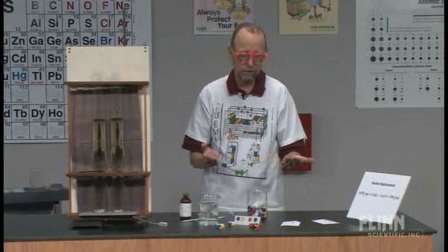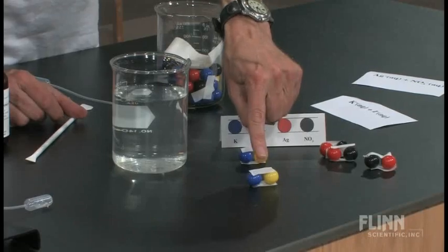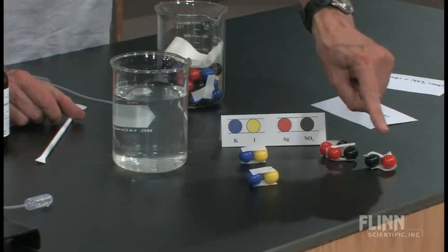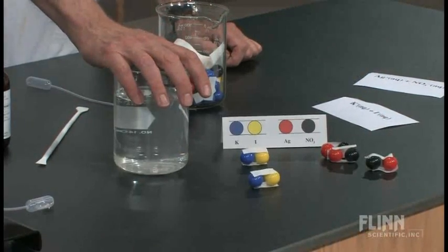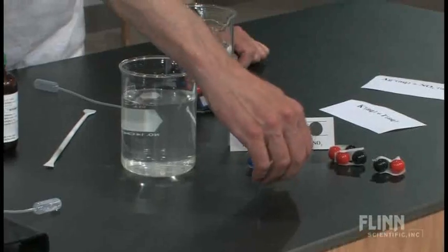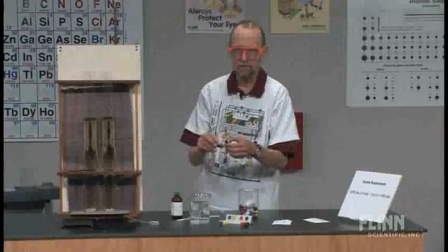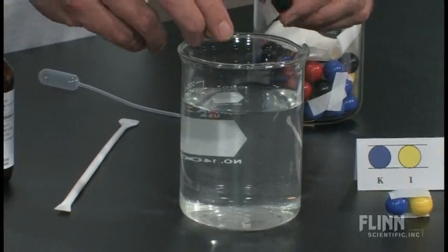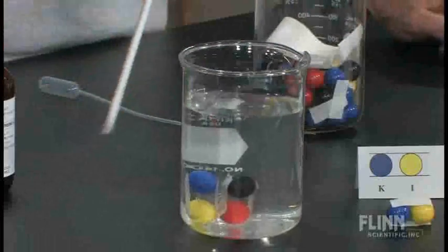Let's do this on a molecular level so you can get a feel for what's going on. Do you remember what I said I have here? This is my potassium iodide, this is my silver nitrate. I'm going to mix these two in this beaker. Here's the water. When I put this in, the solids will dissolve and the ions will react, at least some of them. This is soluble paper that I have here.